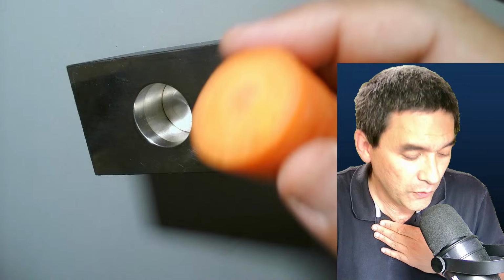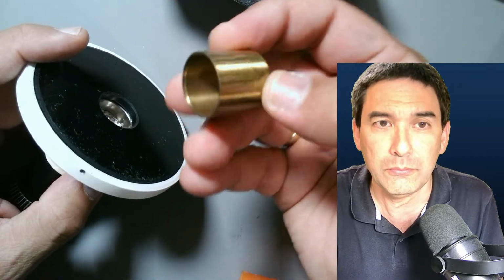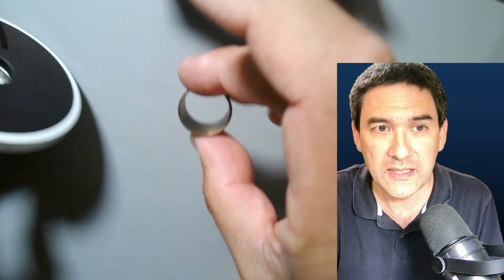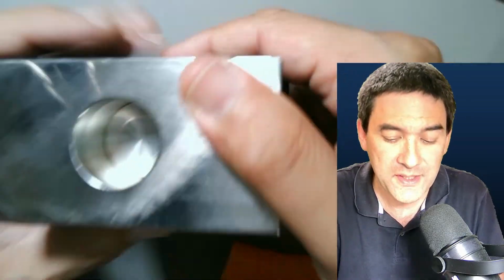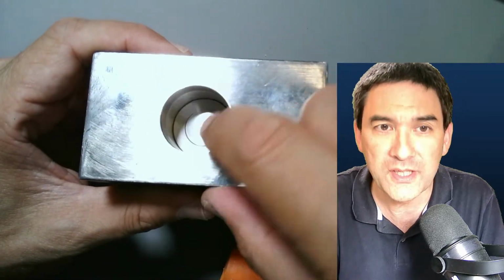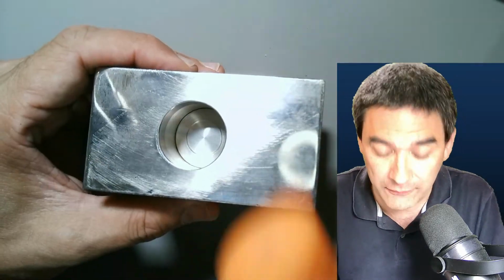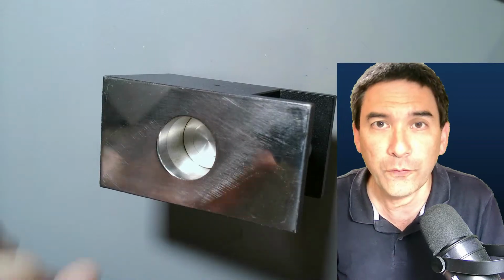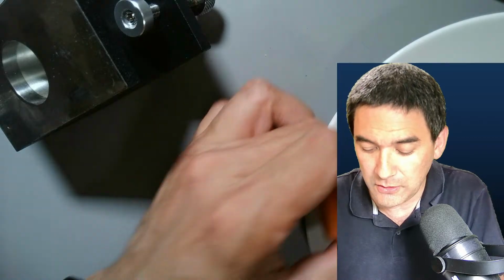I want to show you the problem that some of you might encounter and that I have encountered as well. First of all, notice that the other microtome here came with a little round tube which has exactly the same size, so I can punch out the carrot. It's quite a convenient little tool. Unfortunately, this one doesn't come with one, so I'm going to buy a hole punch from a hardware shop, about 2.5 centimeters, around an inch across. So I have to cut the carrot, kind of estimating it. I'm going to show you the problem if you do it wrong first, and then I will use the carrot over here.